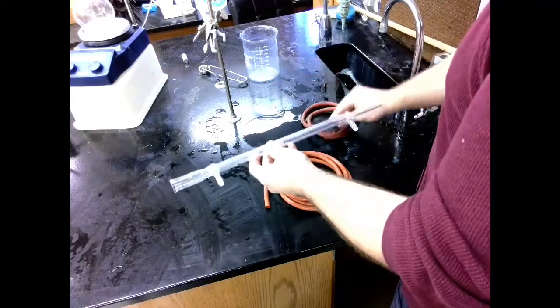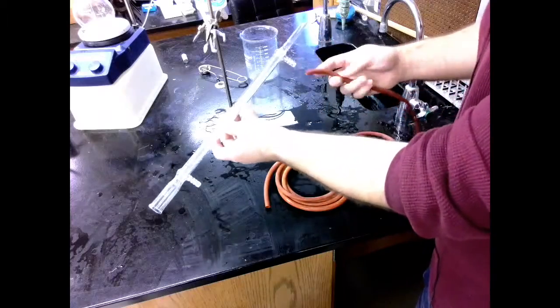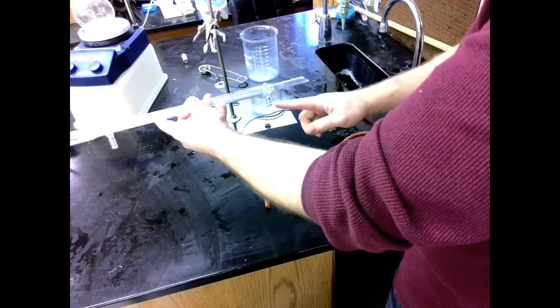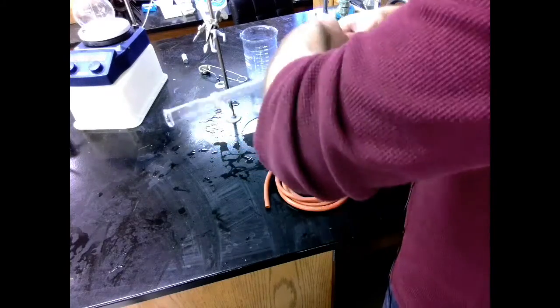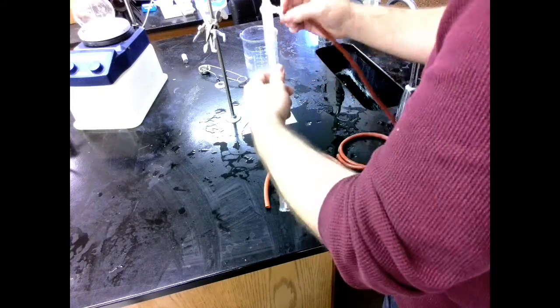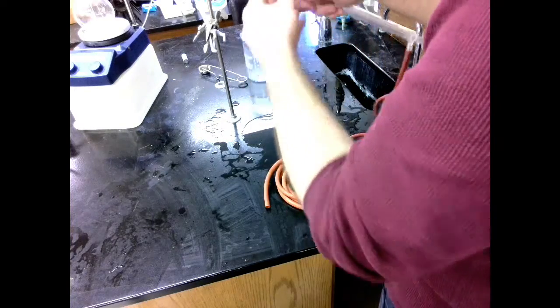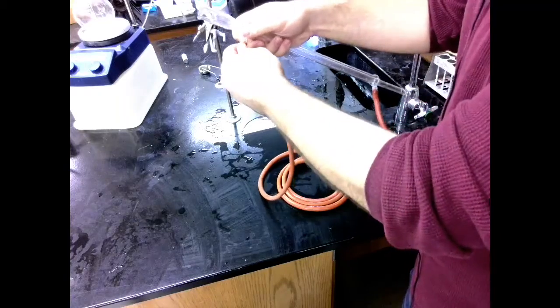We're going to attach our tubes to it. So my shorter tube will go on my inlet port. This is my inlet. This is the side the gas comes out. So this is the side the cold water goes in. So we want the coldest water at the front. This is just going to fit on. It really only needs to go on one of these little notches. It doesn't need to go on super hard.